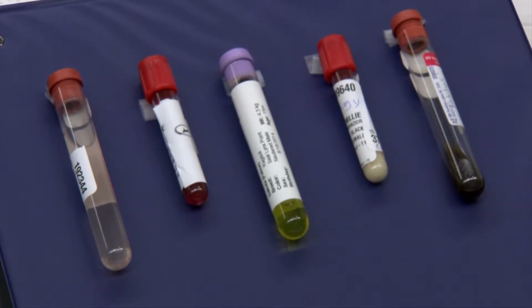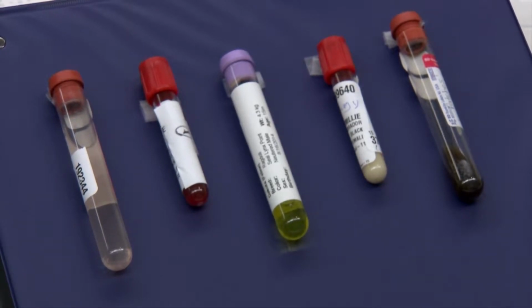If you have joint fluids, we also describe whether they are viscous or not, and we also describe whether there is any fibrin, clots, flocculent material present. And there are times when the sample is too viscous to make those slides with a PCV tube that I demonstrated.